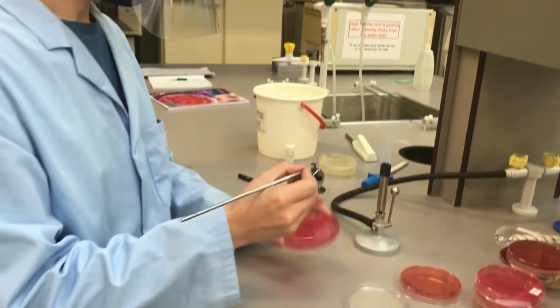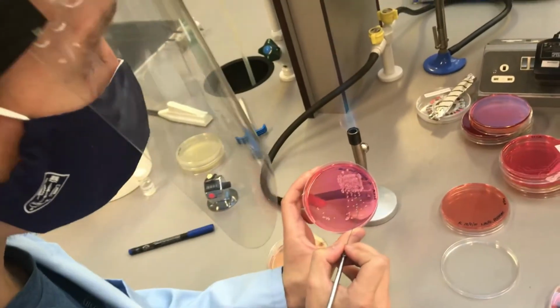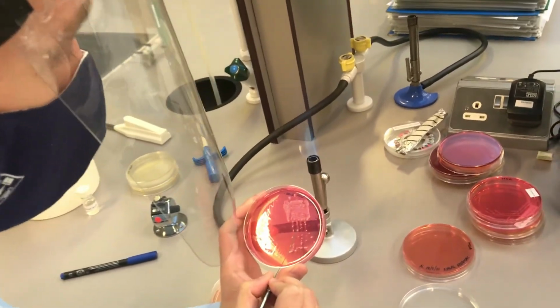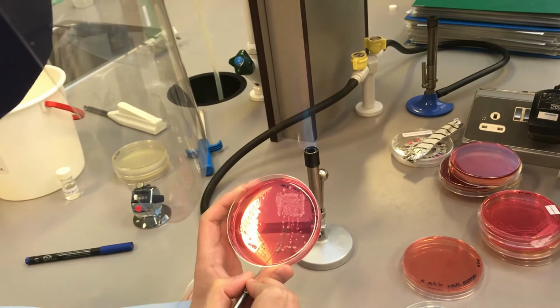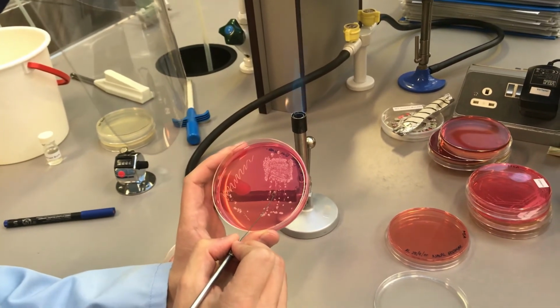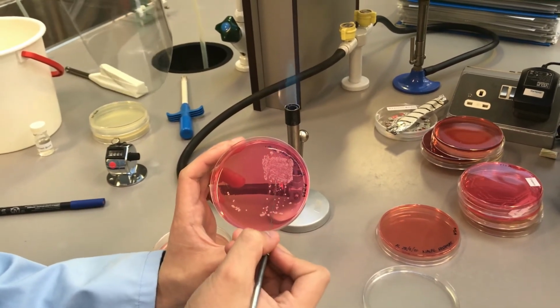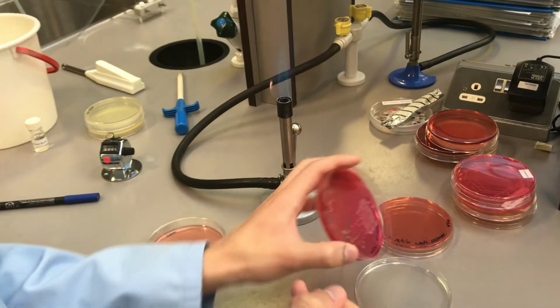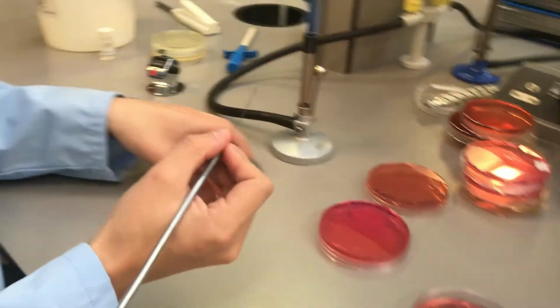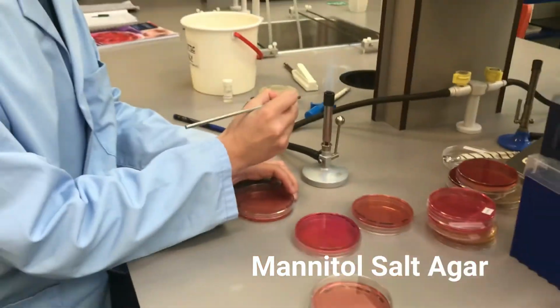Try to pick the whole colony without picking any neighbouring colonies. Use this to inoculate a small section of a fresh MSA plate and use the streak plating technique.